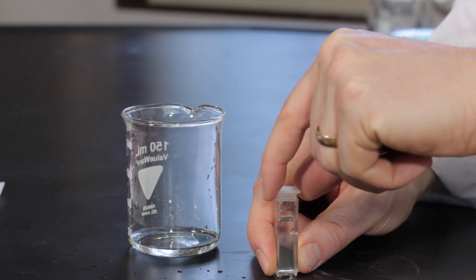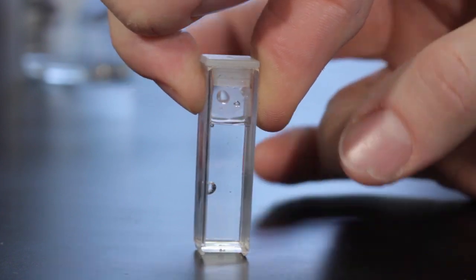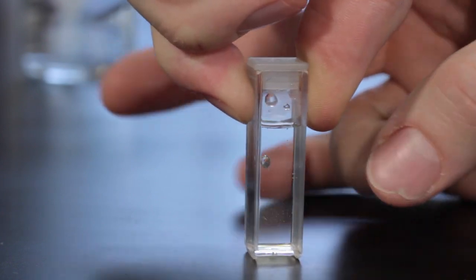Always cap the cuvette before inserting it into the colorimeter. Make sure there are no bubbles in the solution. If there are, flick the cuvette.